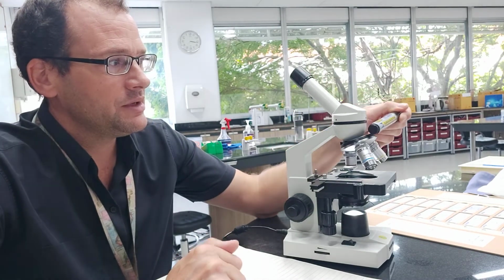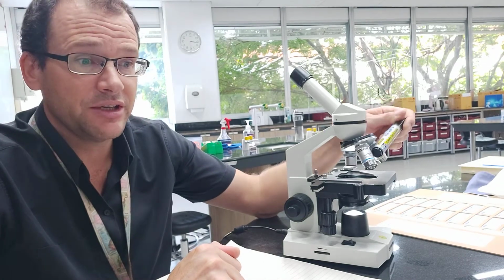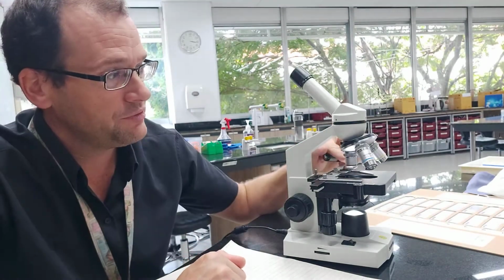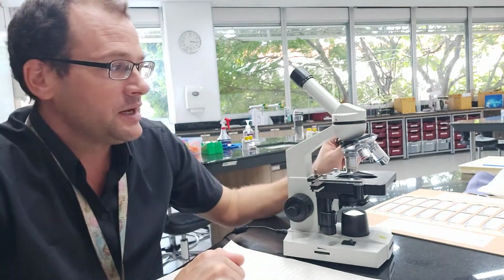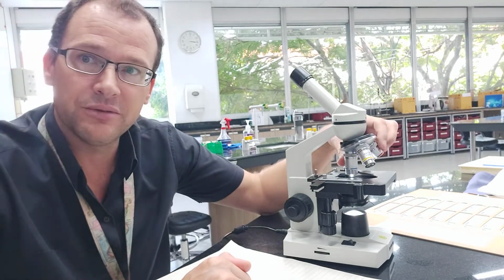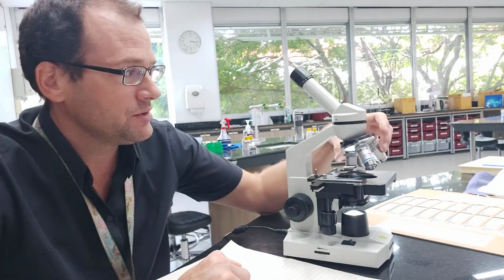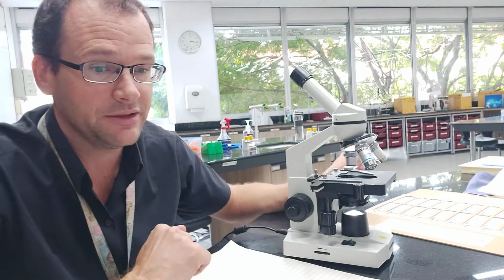Okay, we come down to this part here. We've got 3 different lenses here. We call these the objective lenses. And you have the small one, which I want you to always start using the small one, which is 4 times magnification. And you can swivel this round. You should see the number 10 on the yellow one and number 40 on the blue one, if you've all got this kind of microscope. Okay, so switch that round. We've all got on the 4 times magnification setting on the objective lens.